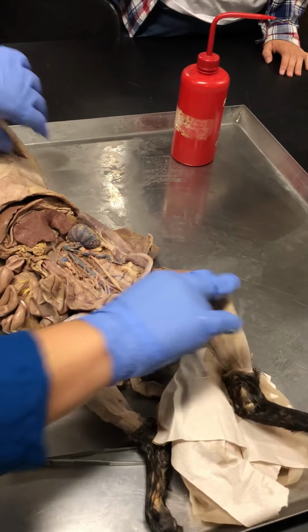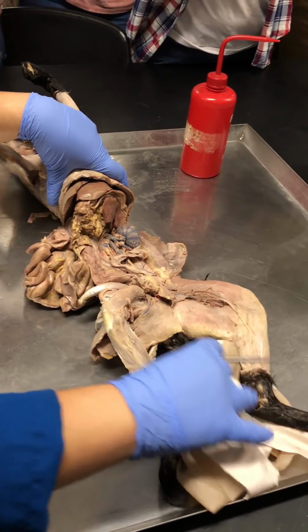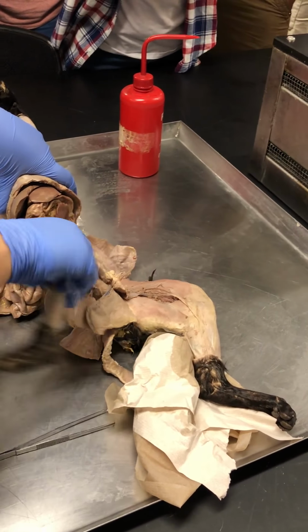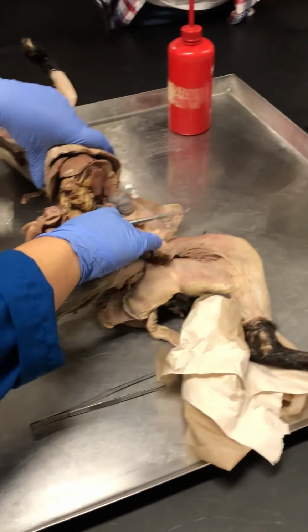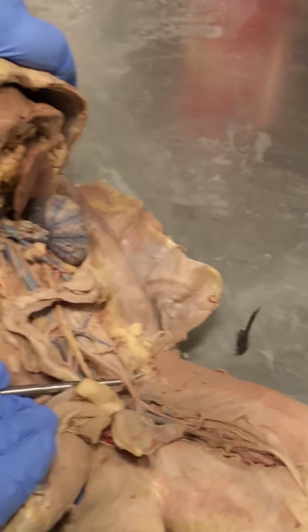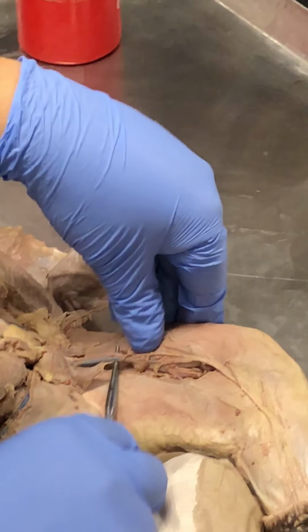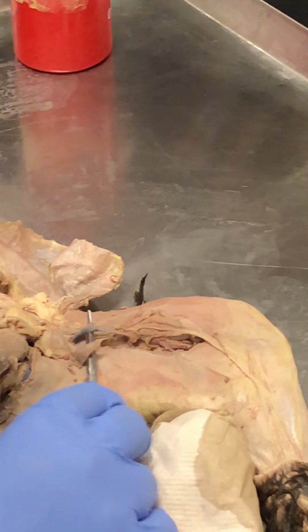After that, take a look at the external. Go back to the external and then trace it to one leg. I typically like to work on the leg that's been dissected, but I don't know how I broke the femur, but I did. So, I had to go this way. Follow the external, right here. Follow it outside. So now this external iliac artery, once it passes the inguinal ligament, it now becomes these two. And these are the femoral artery and veins.